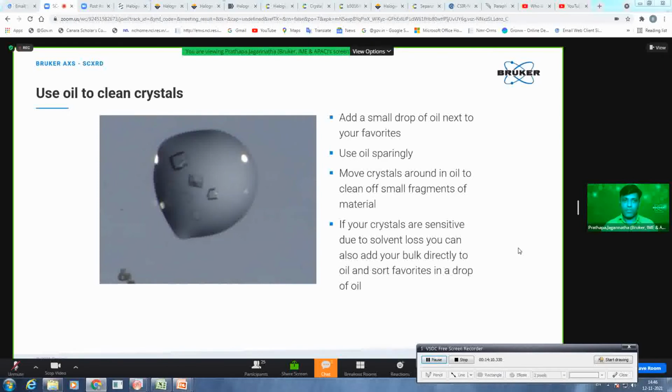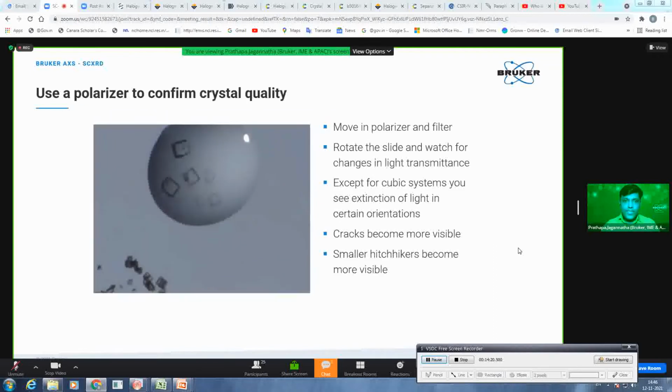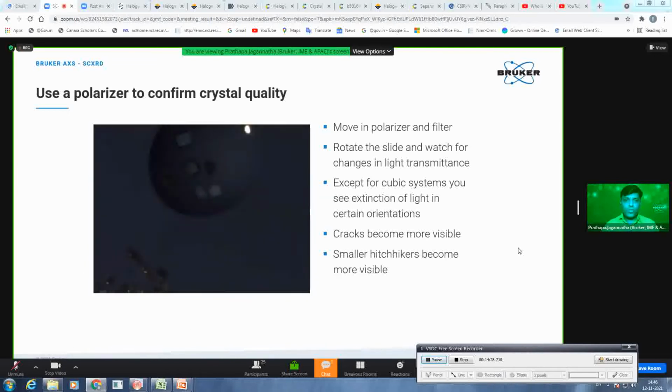So that's an added advantage along with washing your crystal, and also it acts as a protectant for your crystal as well if it is air sensitive or something. Once he does that, he will look under the polarizer under the microscope. So he wants to make sure whatever candidates he has chosen are good enough or the right ones.